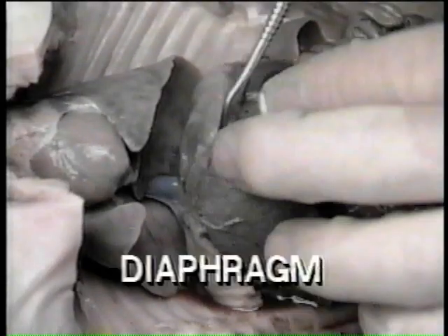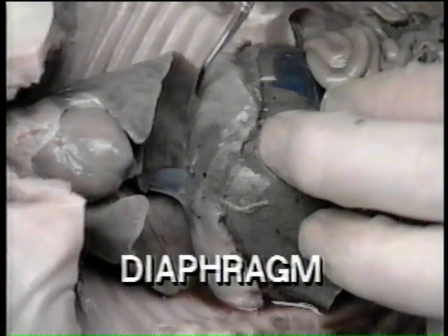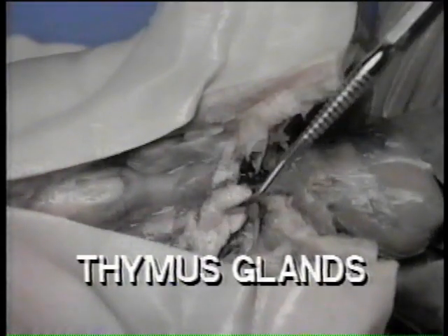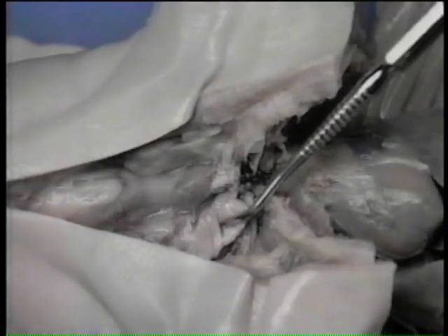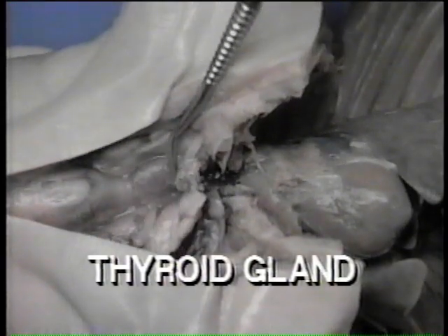The diaphragm is a musculotendinous sheet separating the pleural cavity, which contains the heart and the lungs, from the caudal peritoneal cavity containing the visceral organs. The thymus glands are large, elongated masses extending from the throat region down over the top portion of the heart. The thyroid gland is an oval gland located near the base of the larynx.